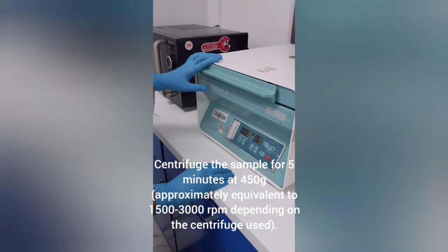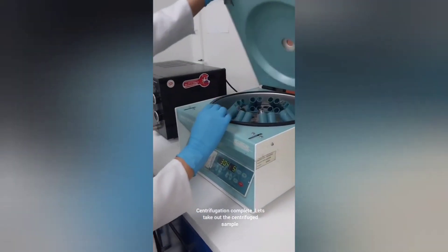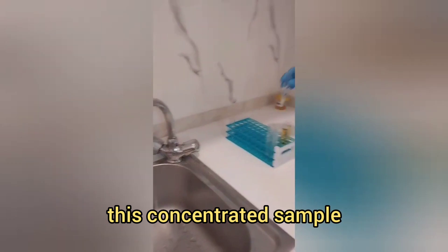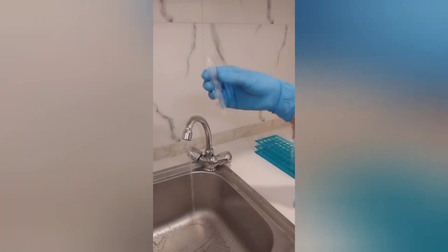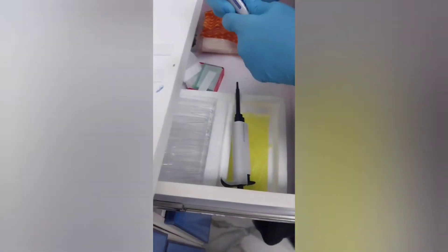Start the centrifuge. Now we will discard the supernatant and we are left with just a small volume of the concentrated sample. For slide making, take one slide and place it on your counter and label it.